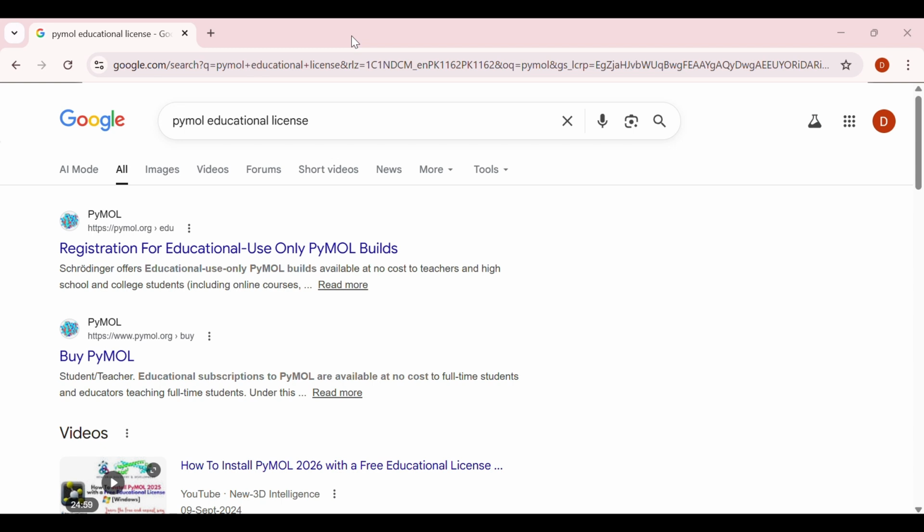Probably noticed that some features are locked. In this video, I will show you step by step how to get and activate a PyMOL license for academic use completely legally and easily. So let's get started. First, a quick overview.